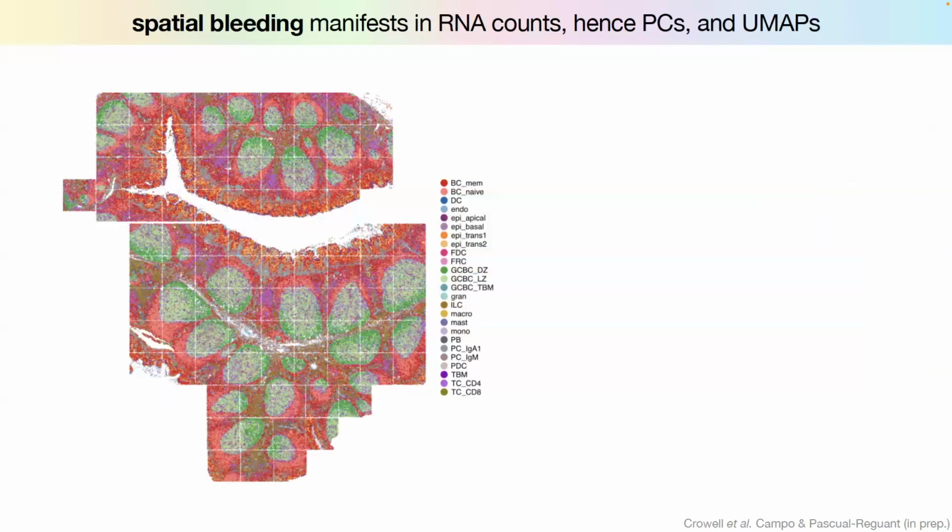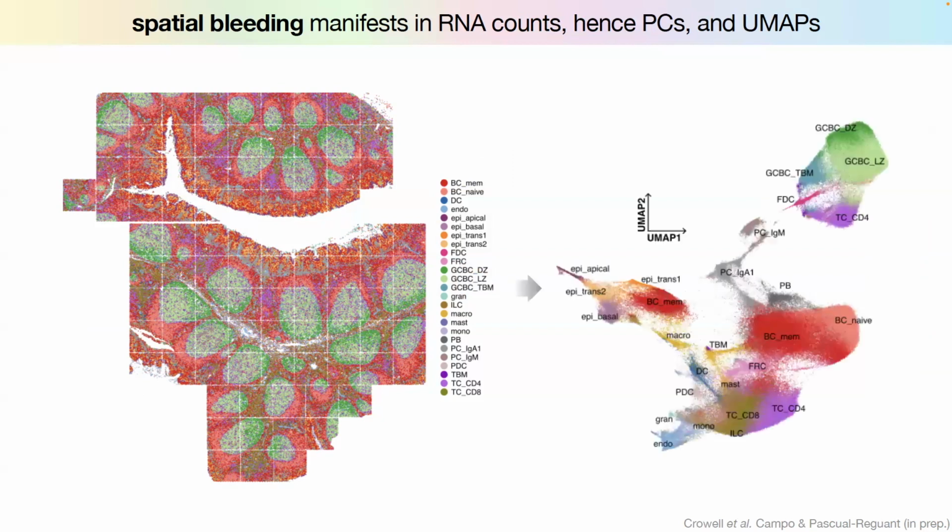Okay, just to show you another example. This is exactly the same data set that I was showing you. And if you do a UMAP, you also see the same phenomenon. So this spatial bleeding, because it goes in your counts, it goes in your principal components, it also goes into your UMAP. And here's an example.